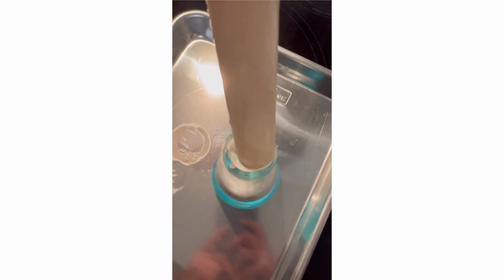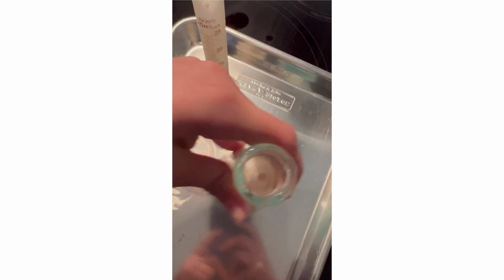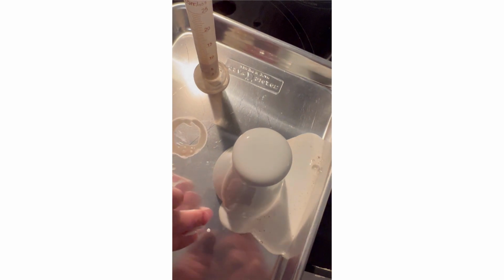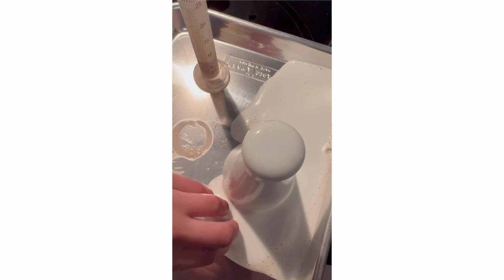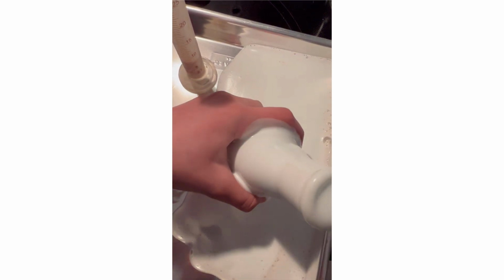There's lab D. The foam is about room temperature. The flask is still quite cold. Ooh.